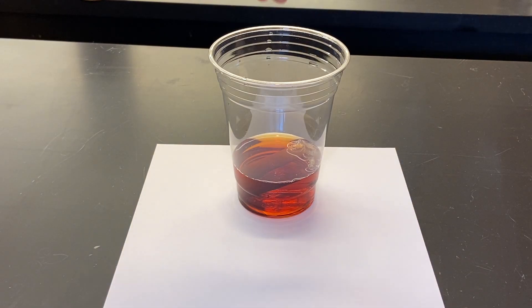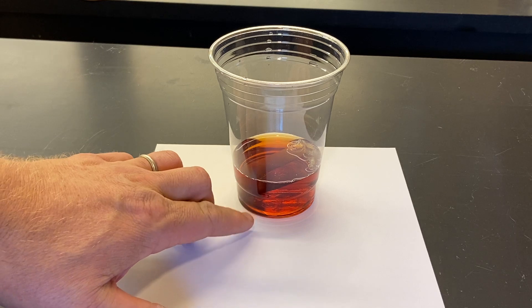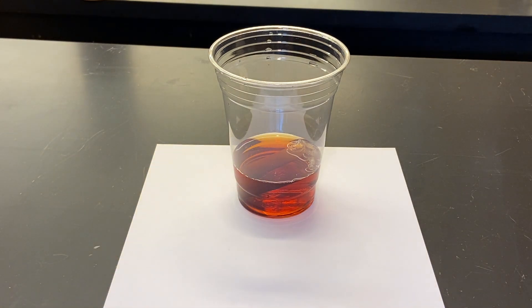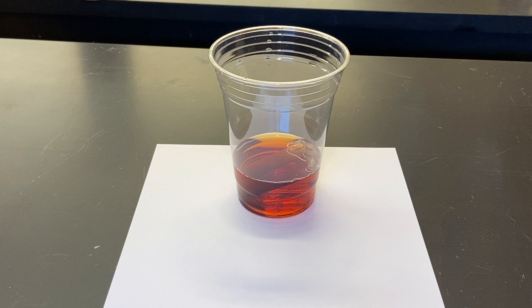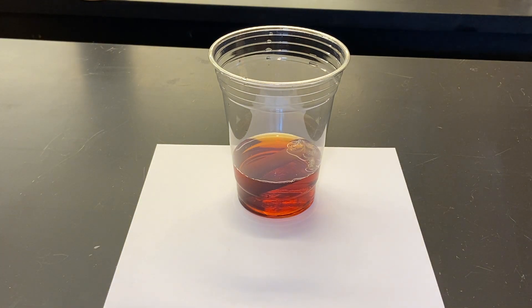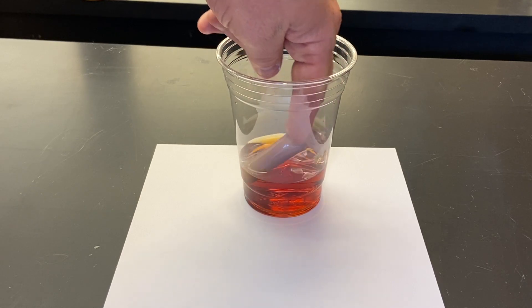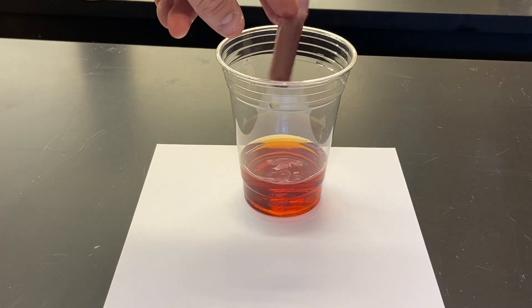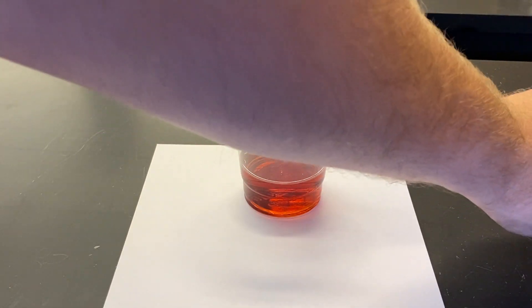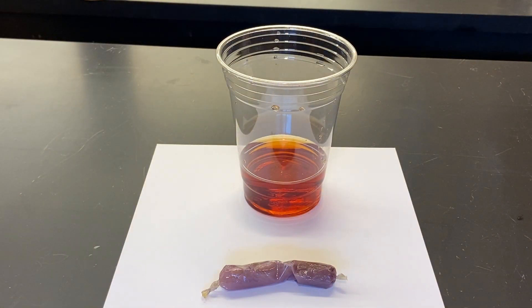We've let our model cell sit in our cellular environment, which is distilled water with lugol solution — an amber-colored testing solution. Inside the cell there is glucose and starch, which was pure white. I'm going to dry it off a little here. After a 10-minute soak, you'll notice what happened to the cell.